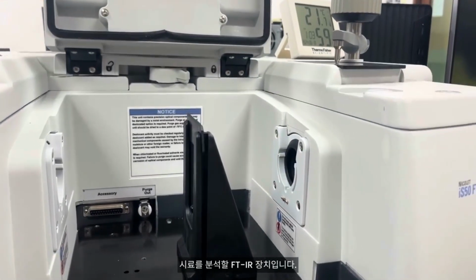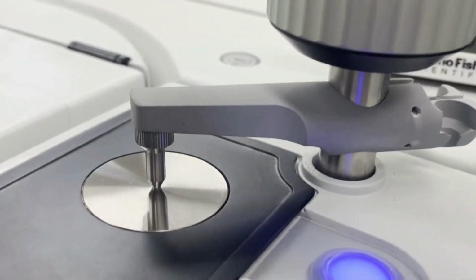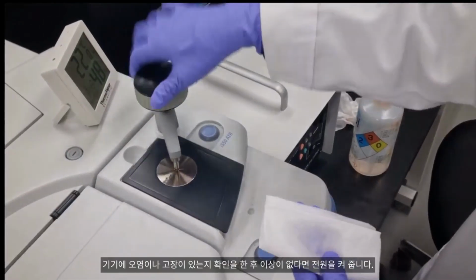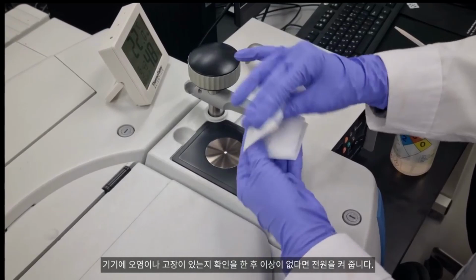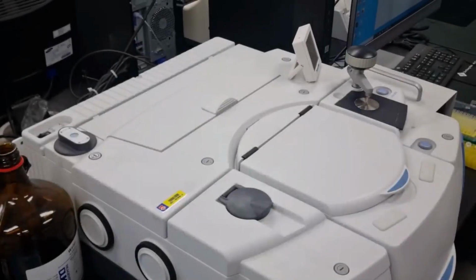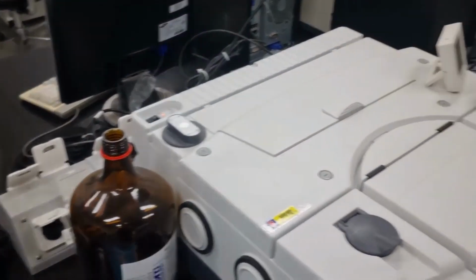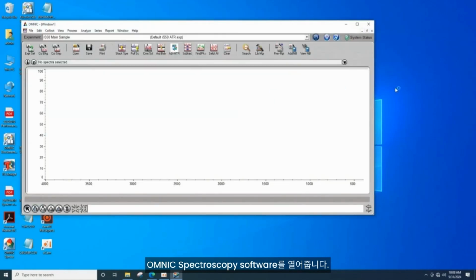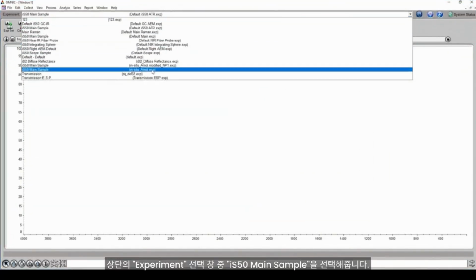This is the FTIR apparatus. The Thermo Fisher Scientific iS50 FTIR is used to analyze the samples. After checking the device for any contamination or malfunctions and ensuring everything is in order, turn on the power. Click the OMNIC spectroscopy software and start the program. At the top experiment selection menu, choose iS50 main sample.